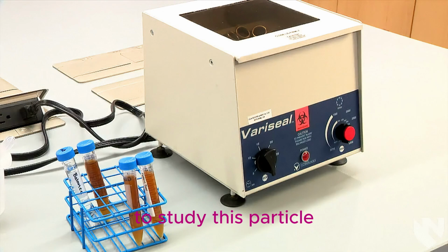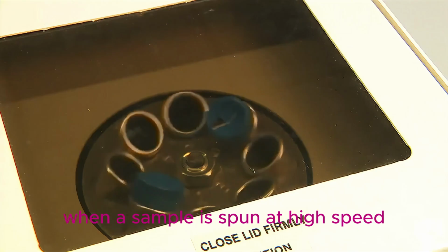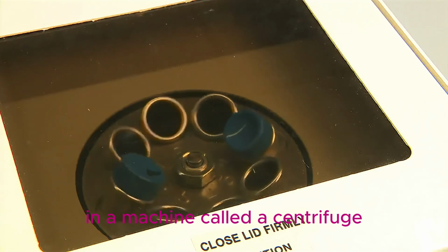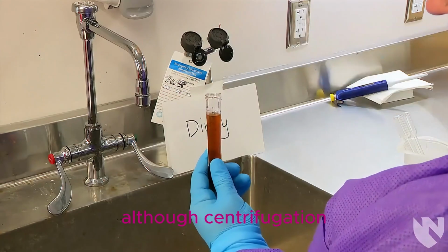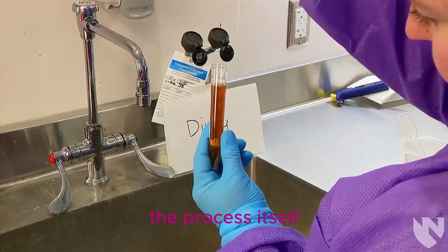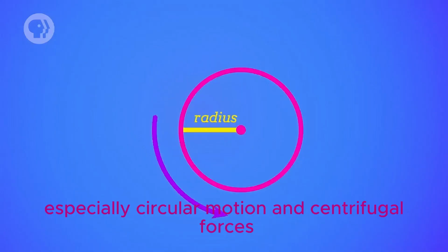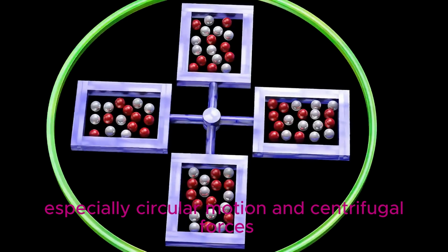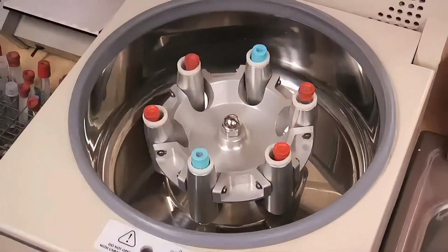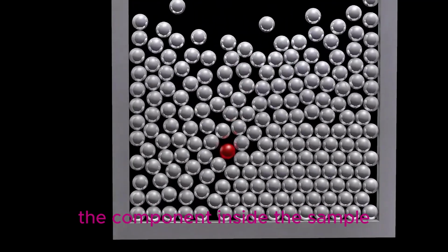To study this particle, scientists use a technique called centrifugation, where a sample is spun at high speed in a machine called a centrifuge. Although centrifugation is widely used in biology and medical laboratories, the process itself is mainly explained using physics principles, especially circular motion and centrifugal forces. In this video, I will explain how urine centrifugation works and how physics plays an important role in separating the component inside the sample.